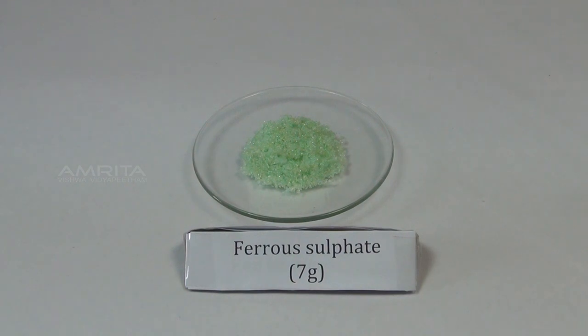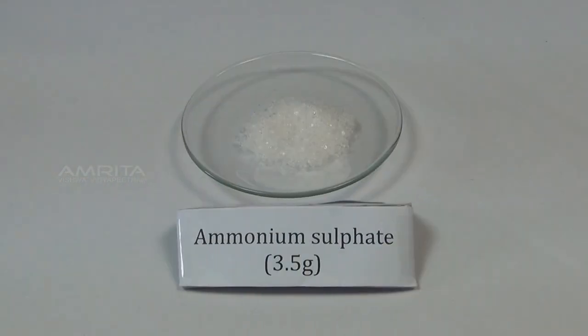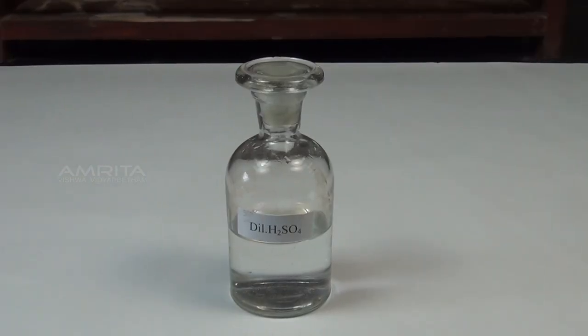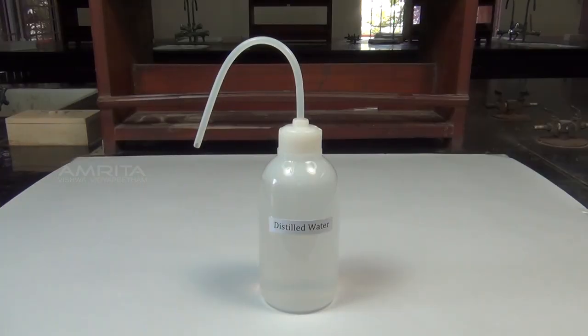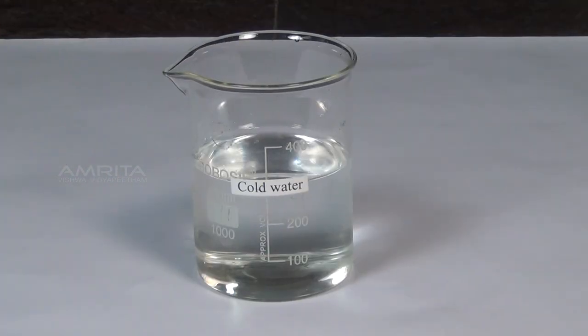Materials required: 7g ferrous sulphate, 3.5g ammonium sulphate, dilute sulphuric acid, alcohol, distilled water, and cold water.